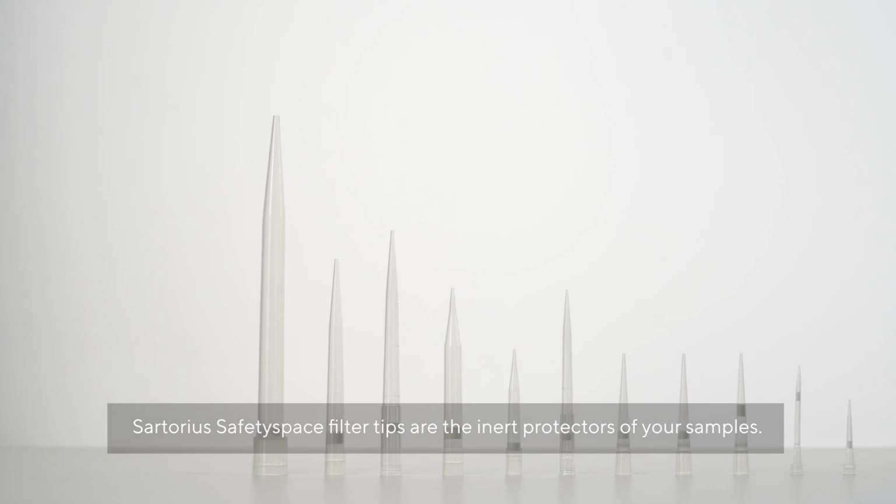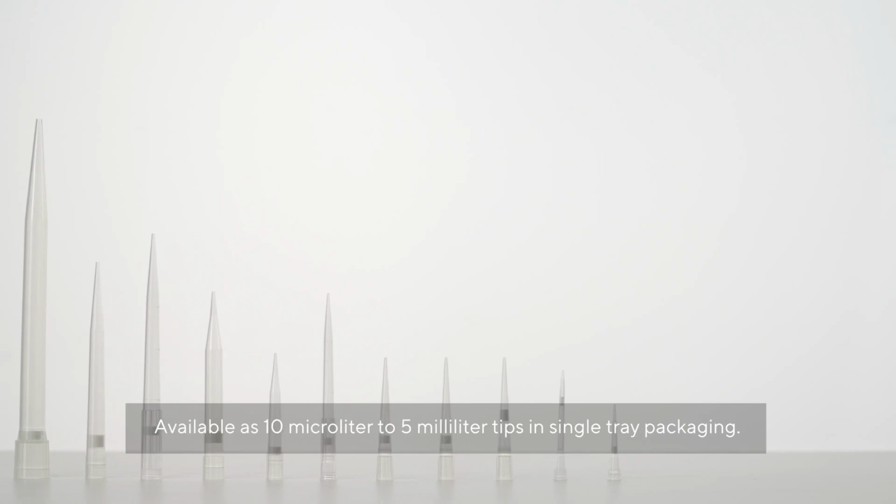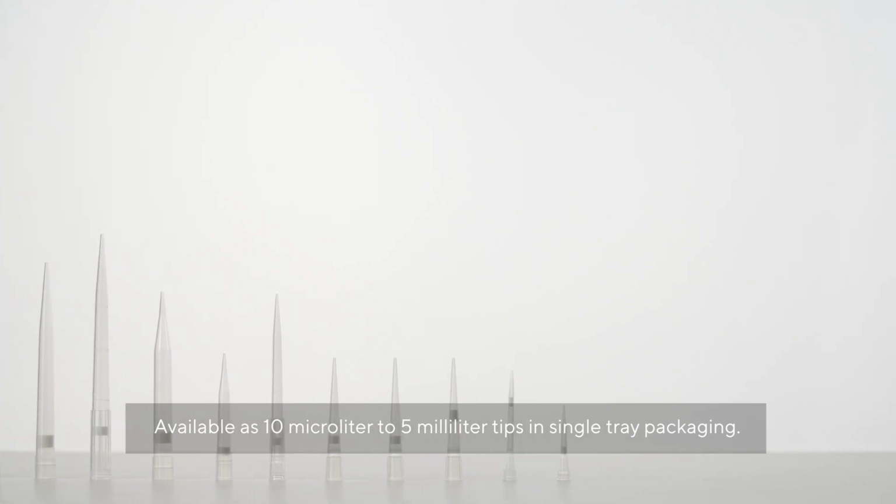Sartorius SafetySpace Filter Tips are the inert protectors of your samples. Available as 10 µL to 5 mL tips in single tray packaging.